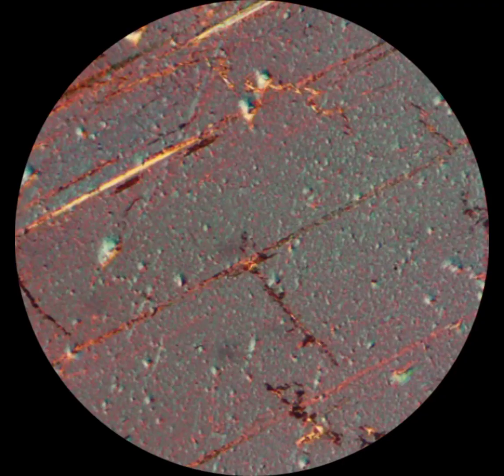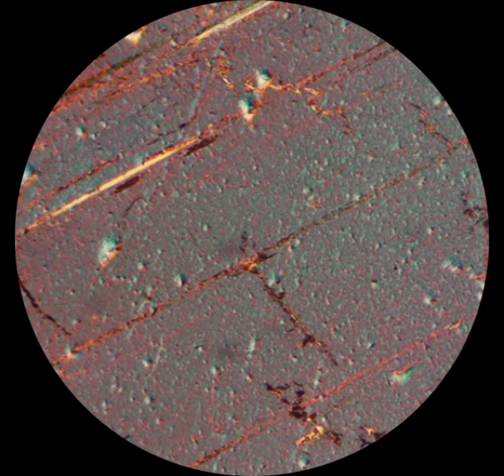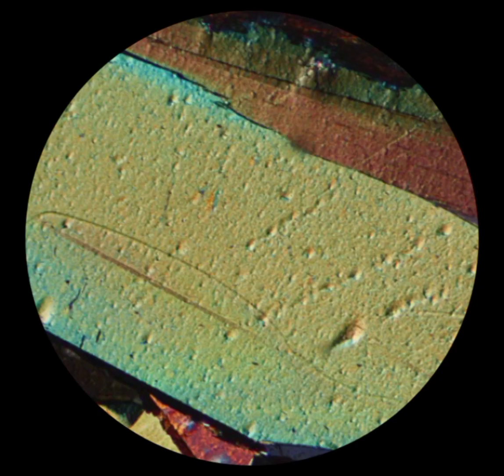Bird-eye extinction, or bird's-eye maple extinction, is a specific type of extinction observed in minerals of the mica group, in which the mineral gives a pebbly appearance on the rotation of the stage.